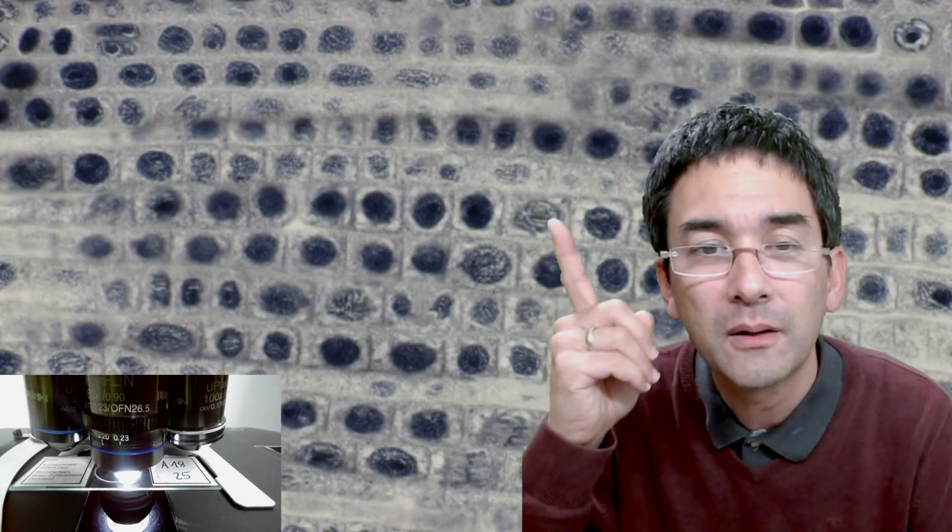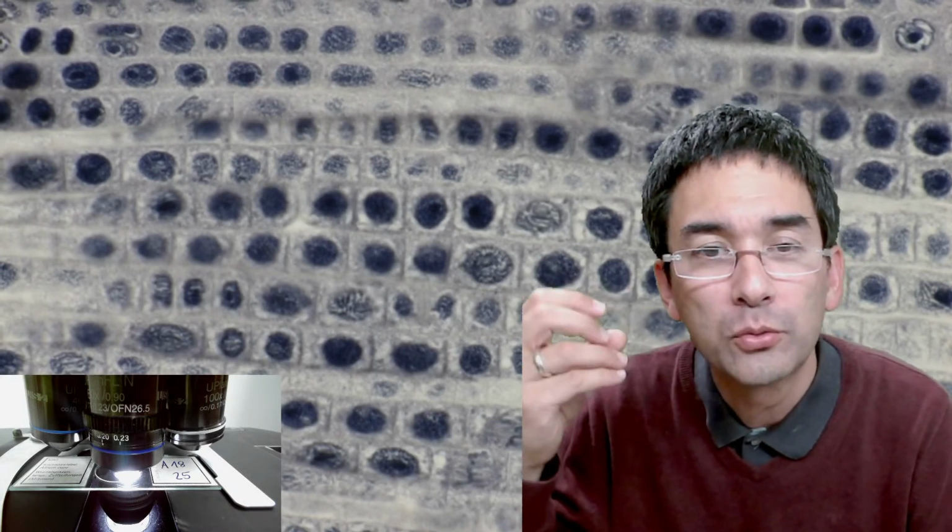Let's point to this one, that's an interphase cell. But look at the one right next to it over here. You see that there are some tiny lines in here. These are already chromosomes forming. So I assume that this one could be about to divide, and the chromosomes forming means that this cell is in prophase. The DNA starts to condense and starts to form chromosomes.